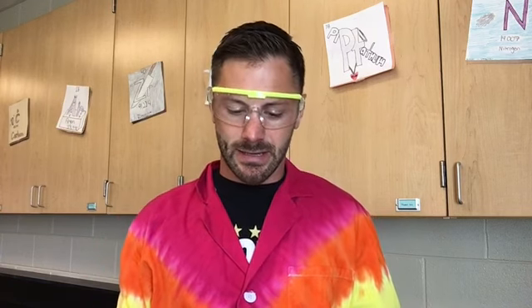Today in class we are doing a lab called Engineering Biodegradable Polymers. We've been talking about molecules with an extended structure in class, and this fits. Now if you're absent, you obviously can't do this lab from home, so I wanted you to see what's happening so you can come to class tomorrow with your observations finished.